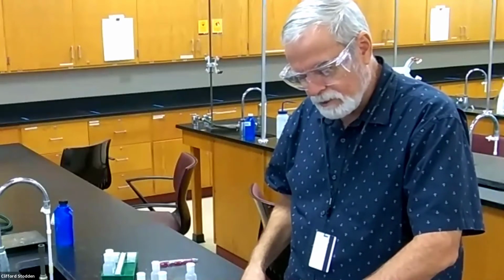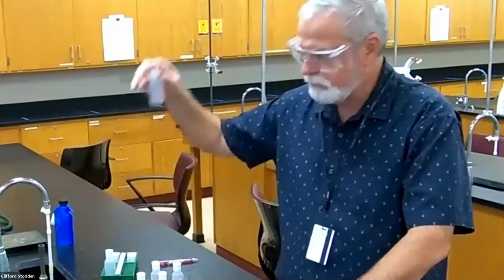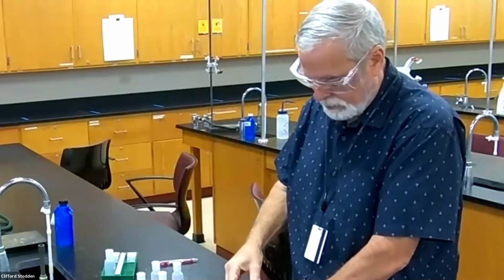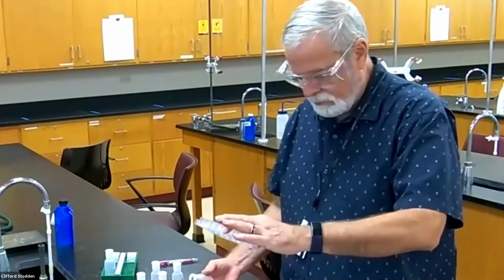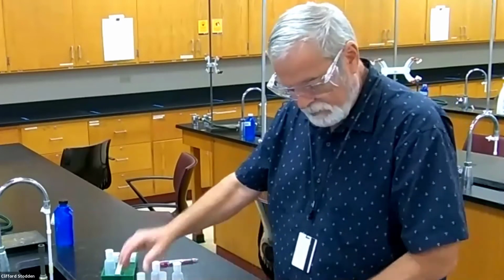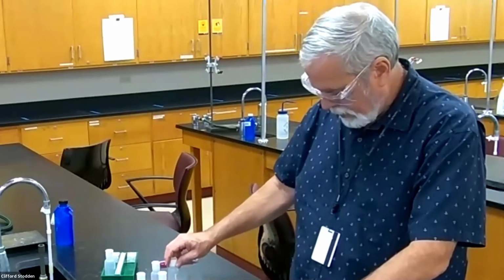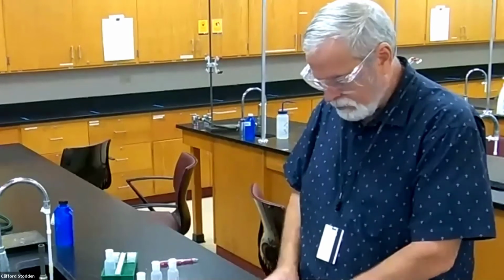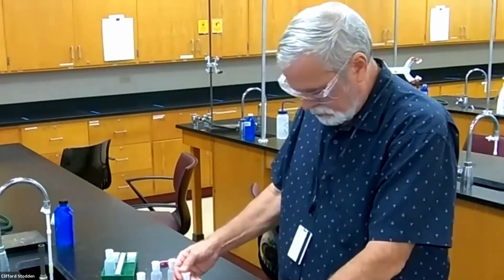Silver nitrate with copper, that could possibly do something. Silver nitrate is a colorless solution. Silver could possibly, and I don't see anything with that. So silver nitrate doesn't do anything with copper. Then after that is hydrochloric acid. I'll go ahead and put hydrochloric acid with it, even though chloride ion we already know isn't going to precipitate with it, but it doesn't, so there's no change with the HCl either.